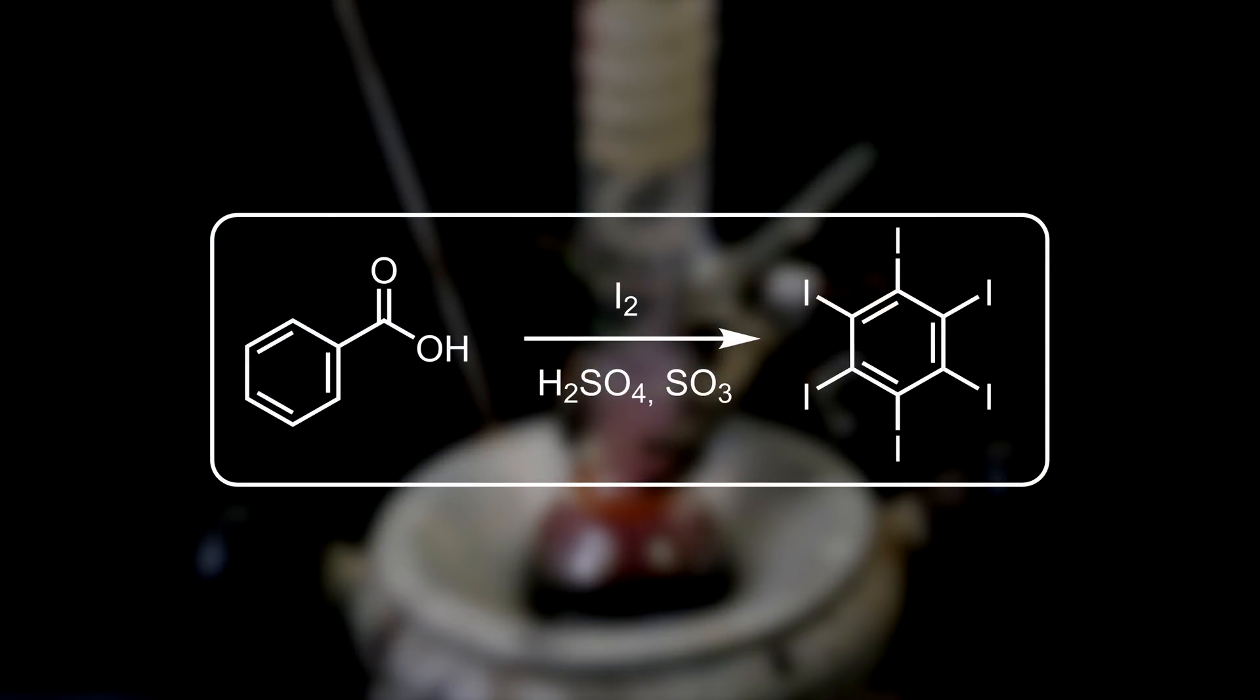In this reaction, benzoic acid reacts with iodine dissolved in oleum to form hexaiodobenzene and some lesser iodinated benzenes, as well as partially iodinated benzoic acids.